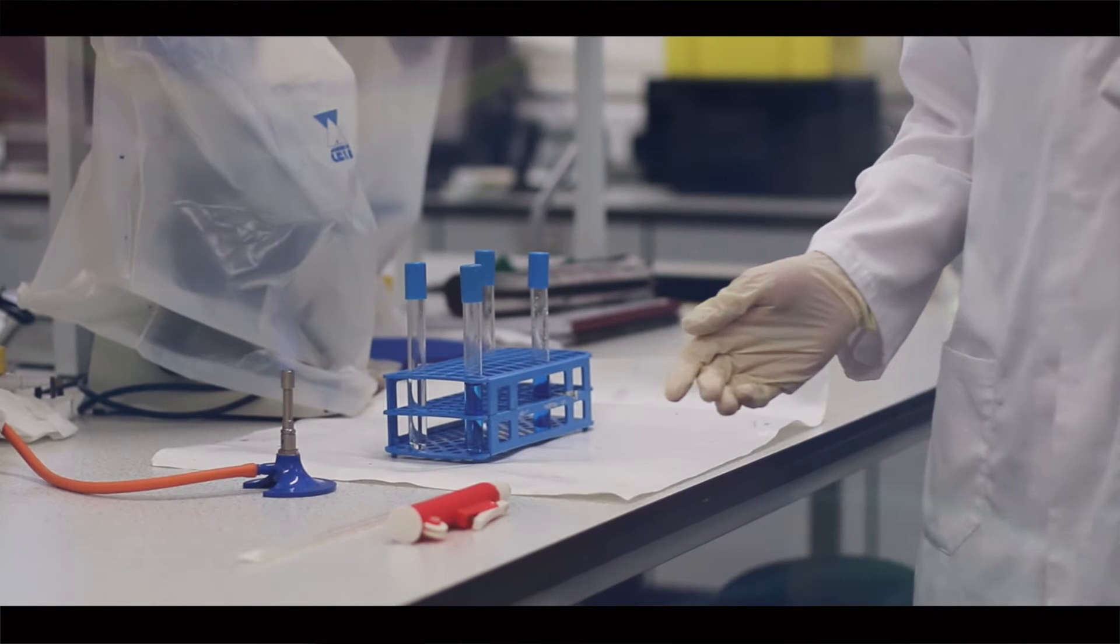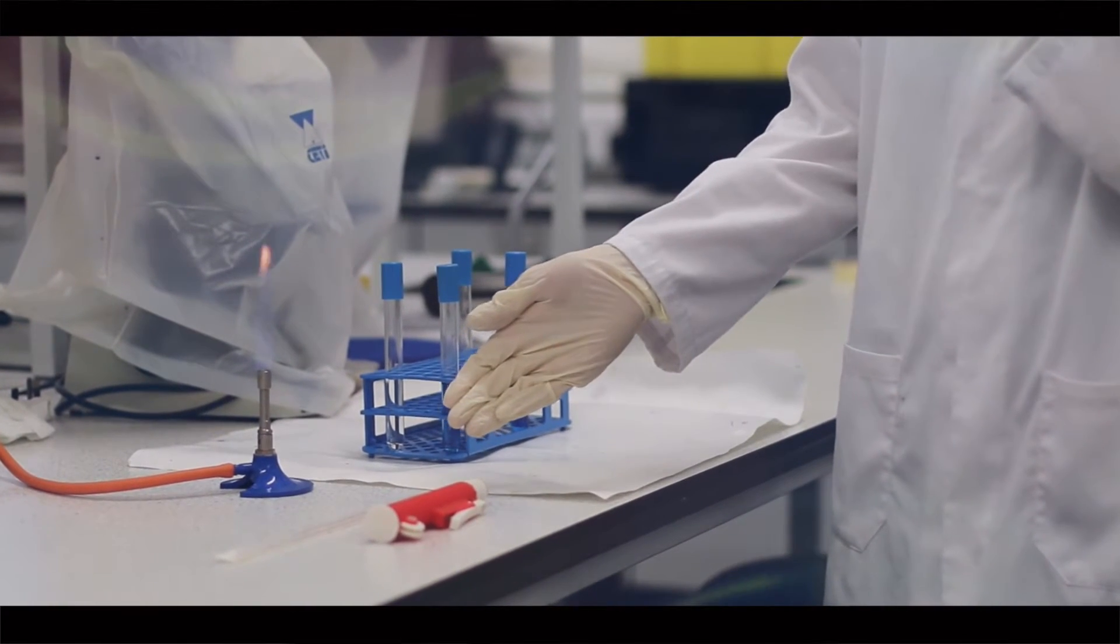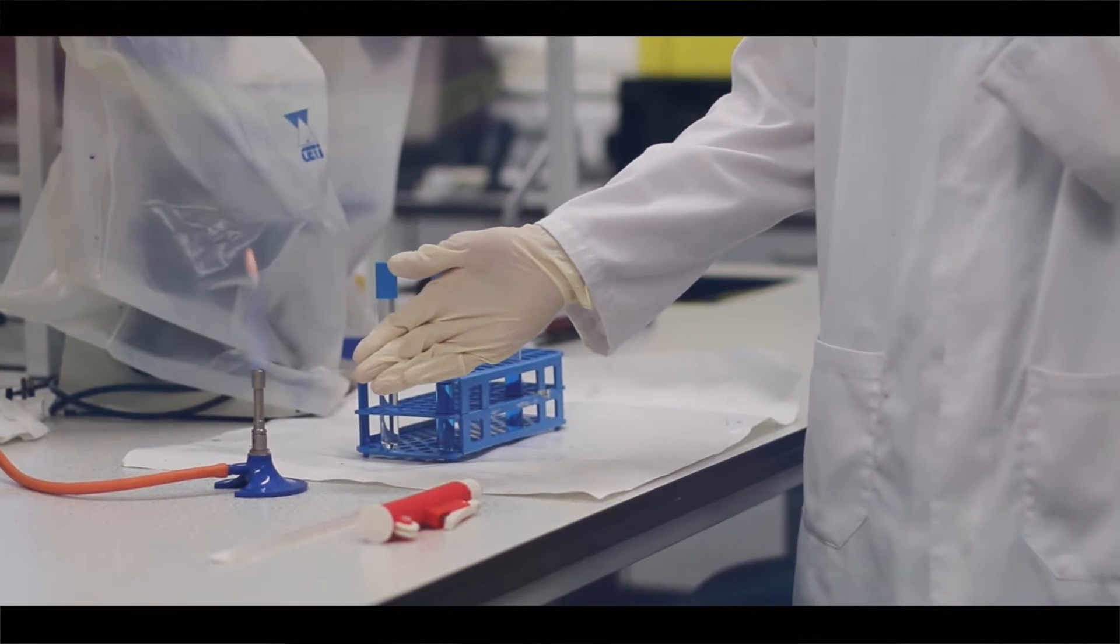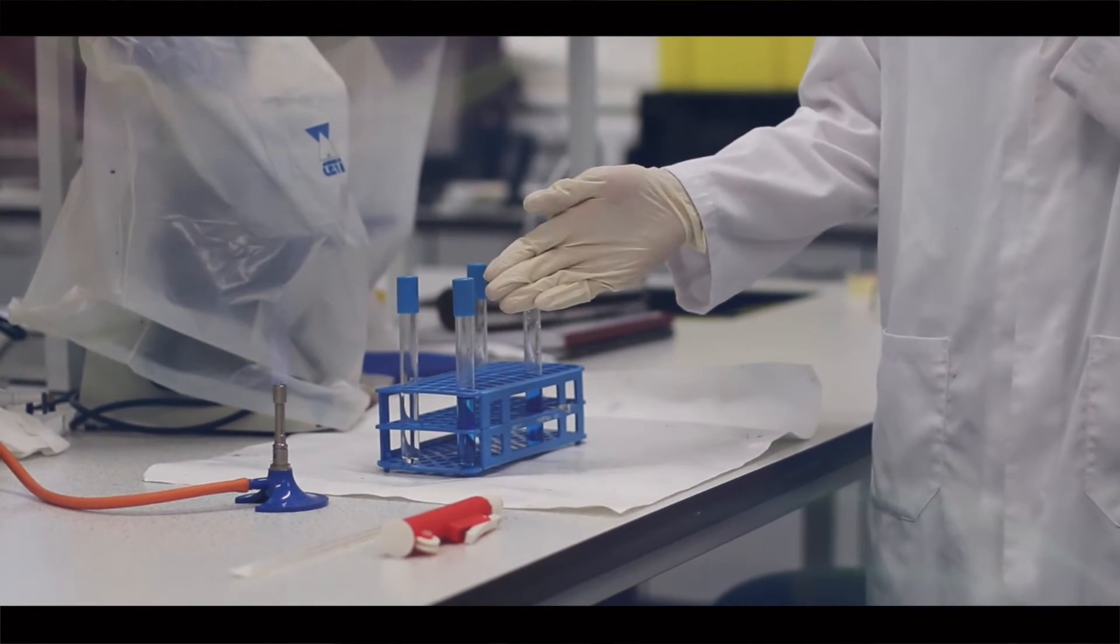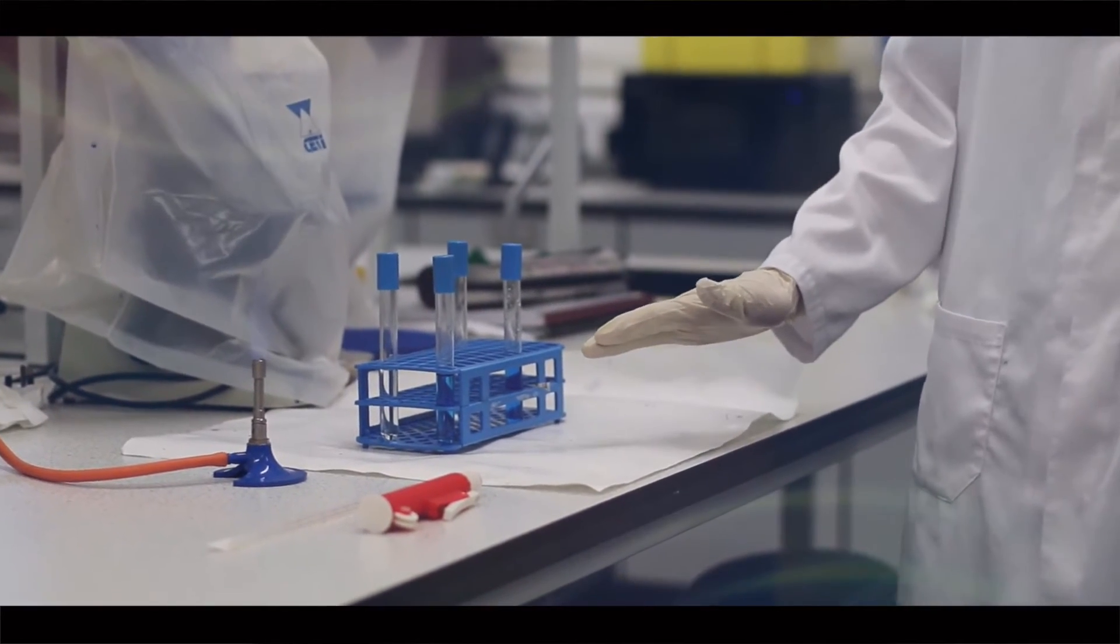For this experiment, here we have the pipette filler, the sterile pipette, the Bunsen burner, the dye solution, the clear solution, and here we have paper to basically keep the table clean.